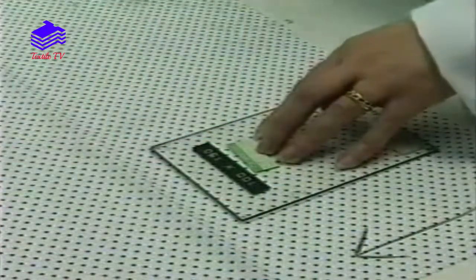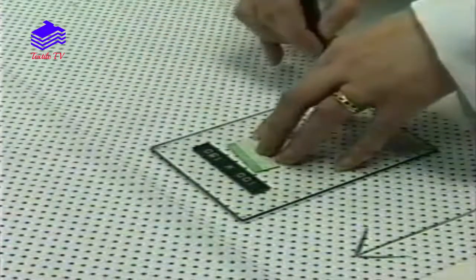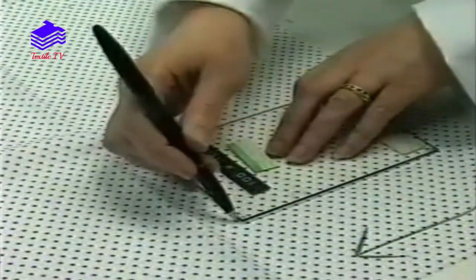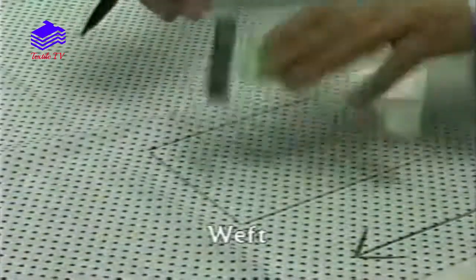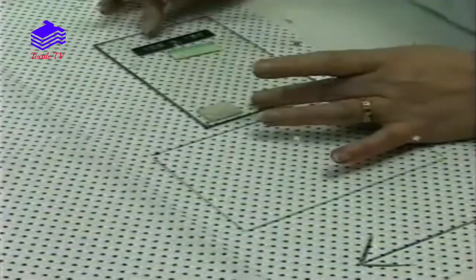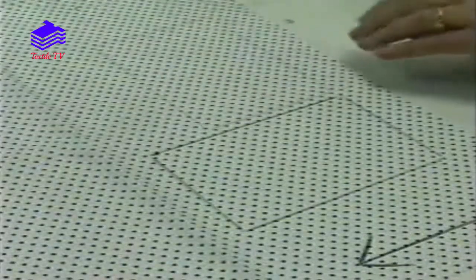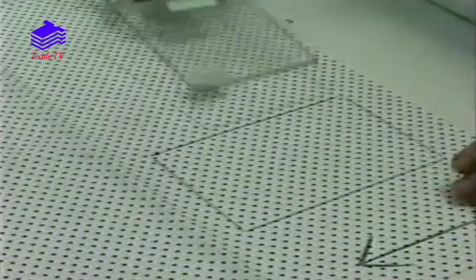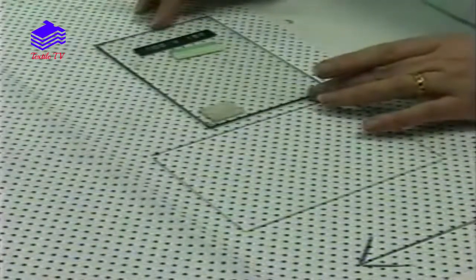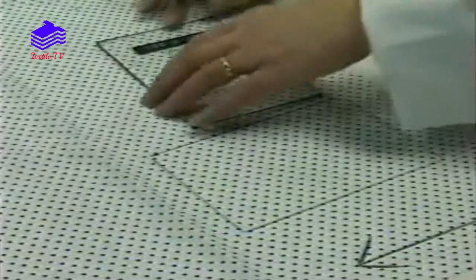Test specimens are prepared by cutting out 5 specimens in the length or warp direction and 5 in the width or weft direction from the sample provided. The specimens are each 150mm by 100mm, the longer dimension being parallel to the direction being tested.